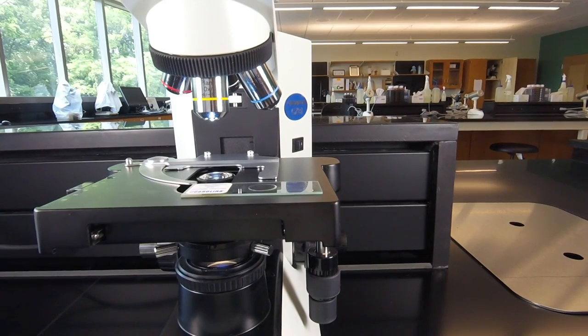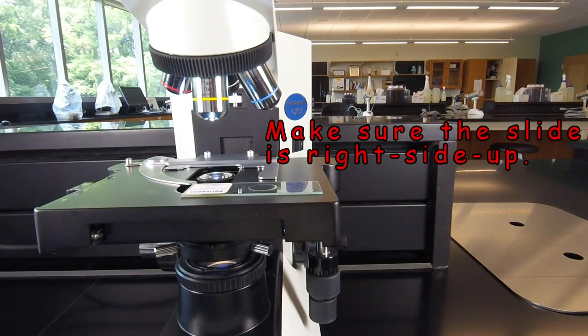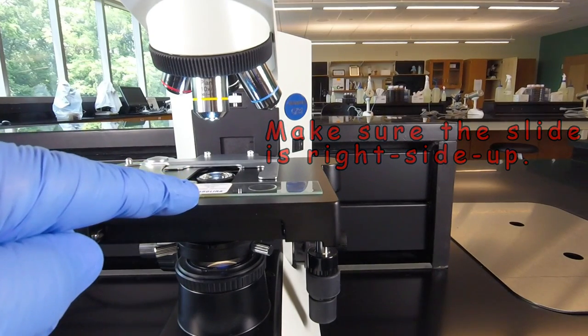The next thing we're going to learn is how to put the microscope slide in the slide holder of the mechanical stage. We want to make sure that the slide has the bacteria on the top, that is that the slide is not upside down. When we make slides or when we use prepared slides, there'll be a label on the top side.